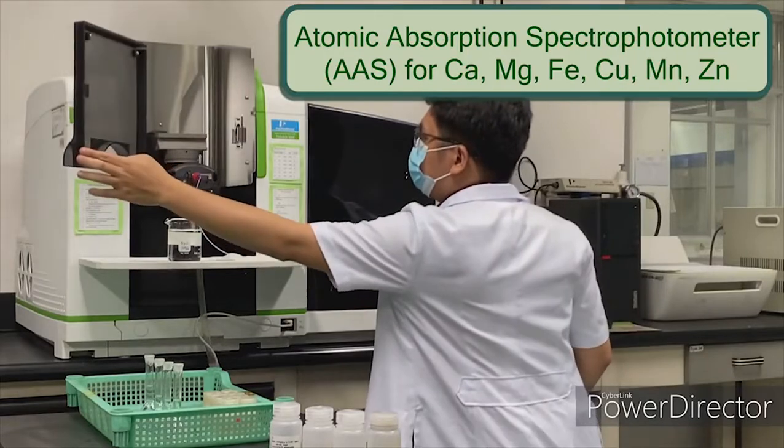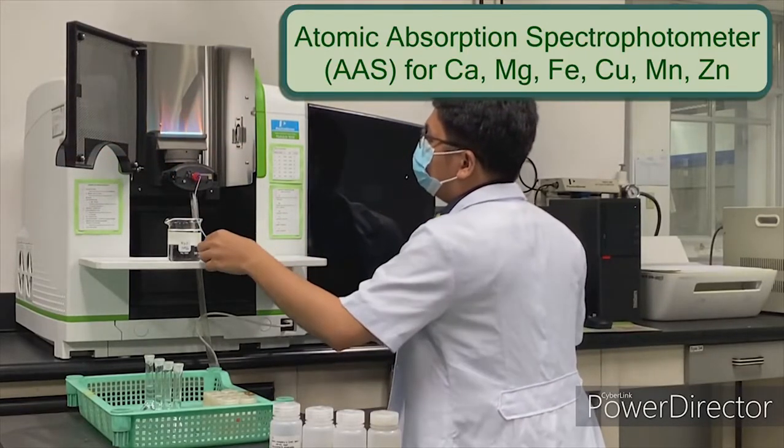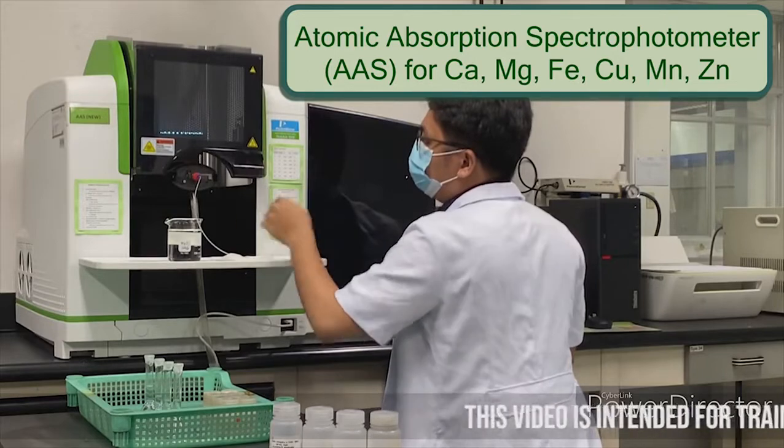While calcium and magnesium, as well as micronutrients like iron, copper, manganese, and zinc, are analyzed using an atomic absorption spectrophotometer or AAS.